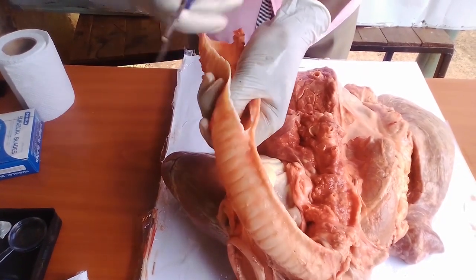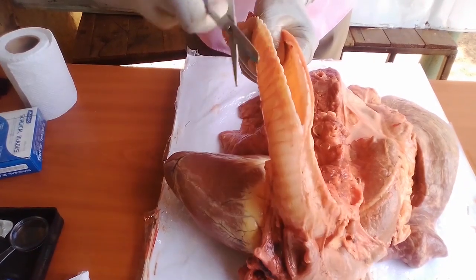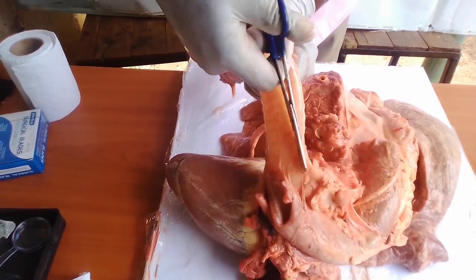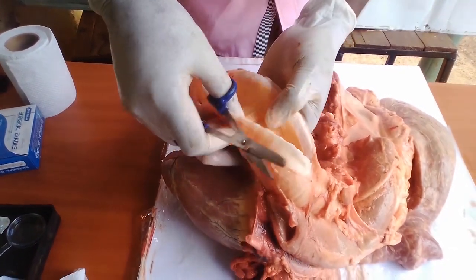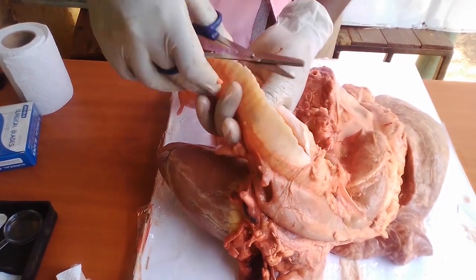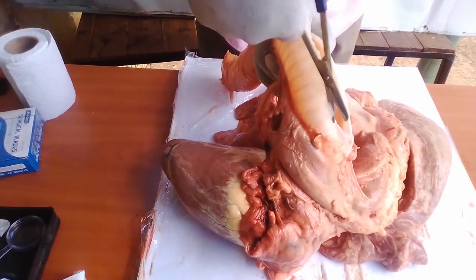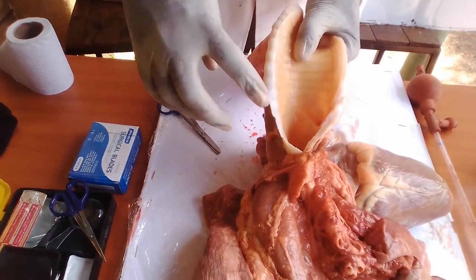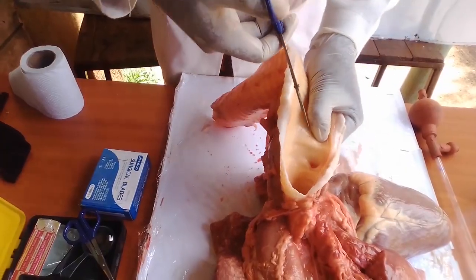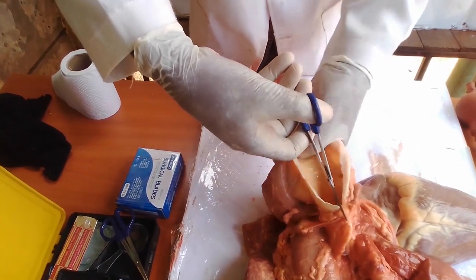You will need to use a pair of scissors to cut through the trachea. We have said that the lumen of the trachea is lined with ciliated epithelium. The cilia beat in waves and move the mucus — there is mucus inside all the air passages. This mucus traps foreign material. The major function of the mucus is to protect the lung through mucociliary clearance against foreign particles and chemicals entering the lung.